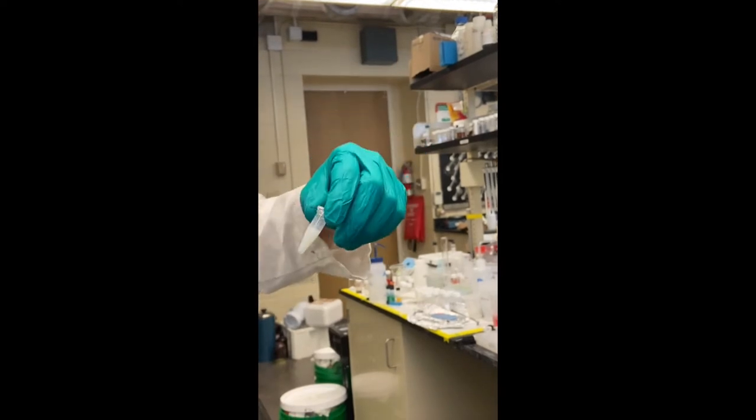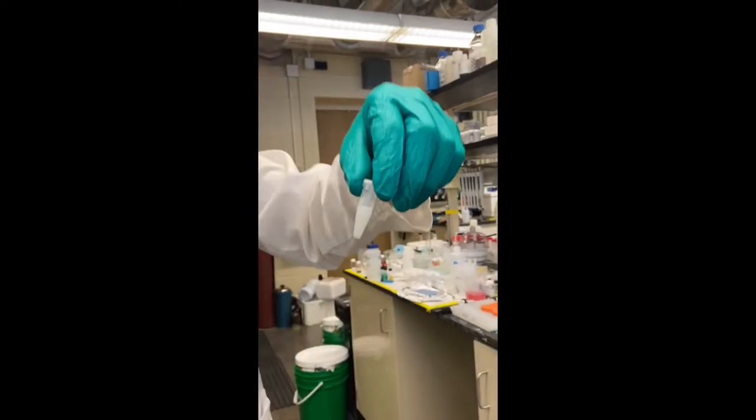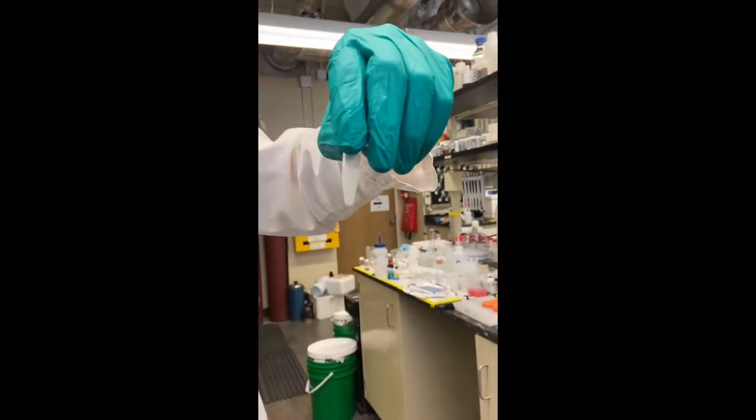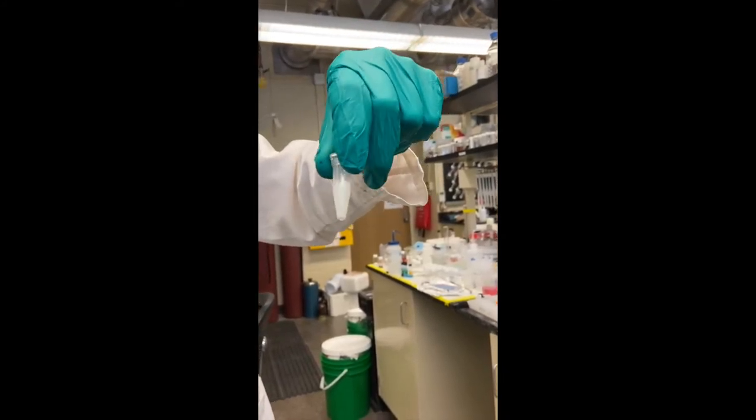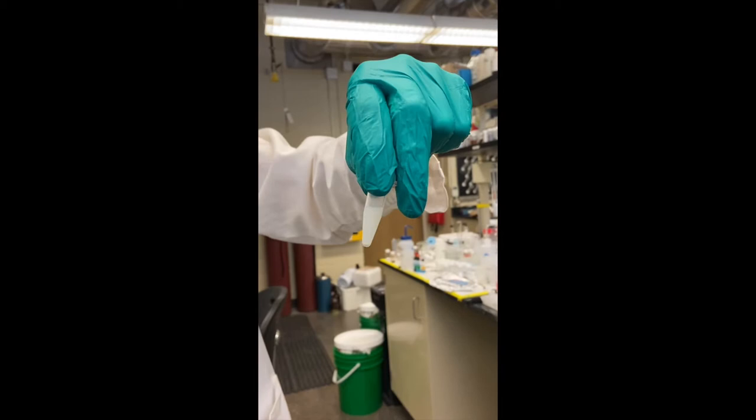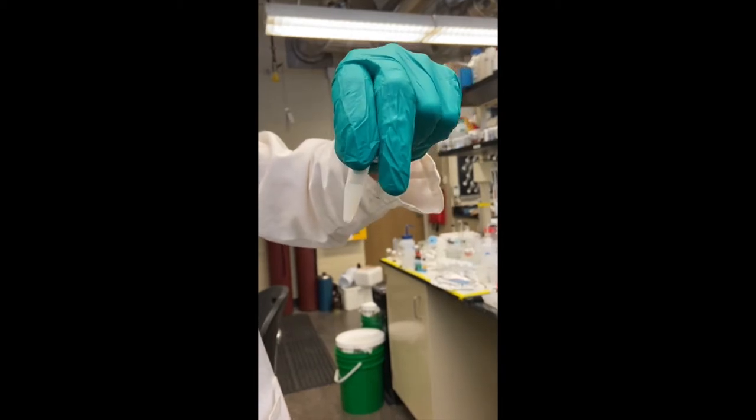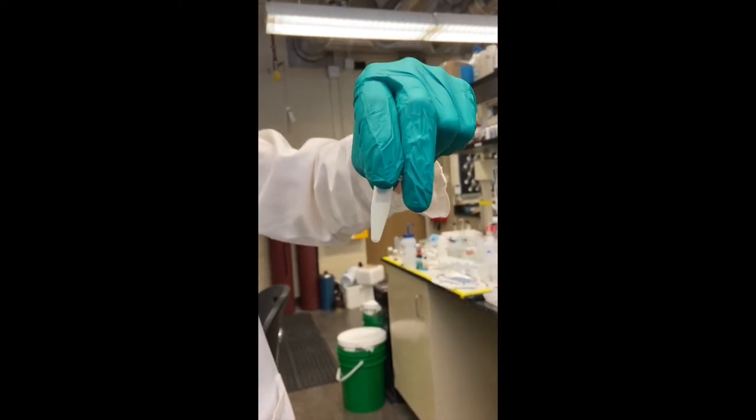Now, this part is a bit more of an art than a science, but this is very cloudy and there would be too many particles when we tried to take a picture on the instrument. So I'm going to serially dilute it in half each time until there's a concentration visually that I'm happy with.